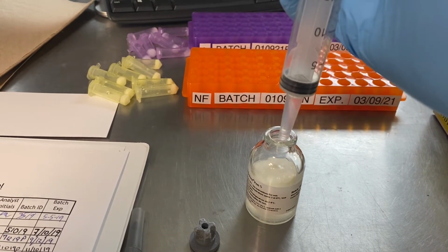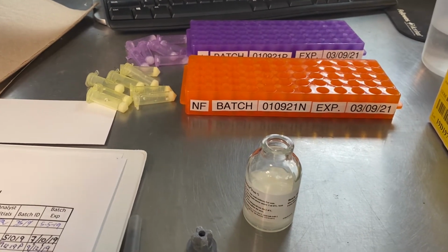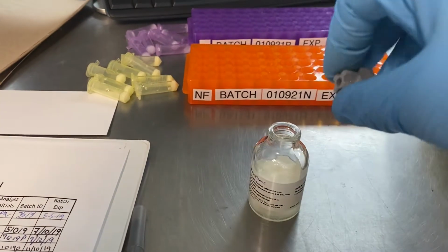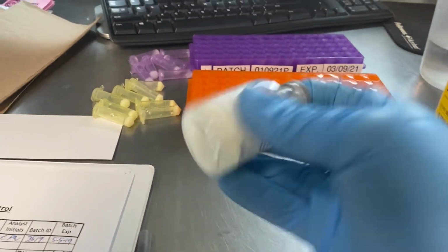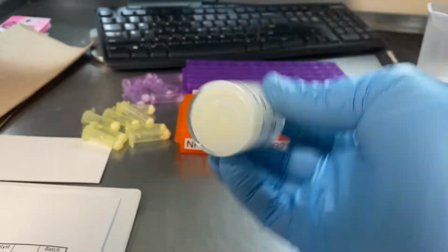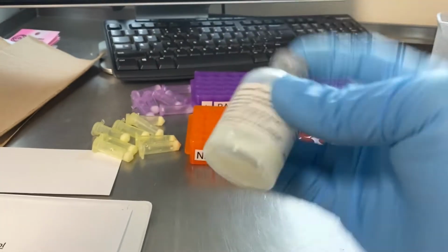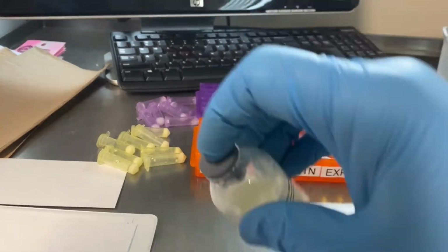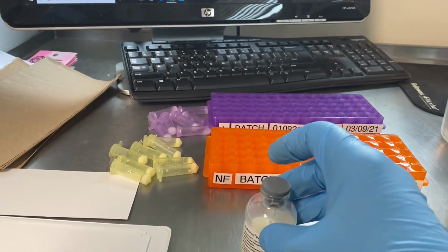When we go to pipette this into our vials, we don't really want to have a lot of foam, so I start by doing this control. So you lightly shake it, kind of get it started. I use the warm water because it helps dissolve it. You really shouldn't have hot water, but a little bit of warm water is fine, just to kind of get it going. And I just give it a little bit of agitation, and then I set it aside.